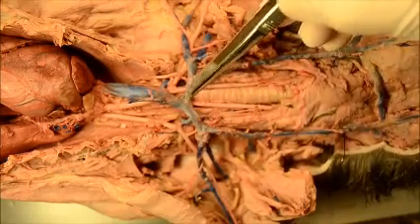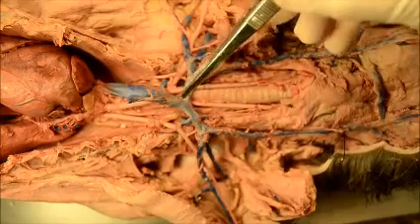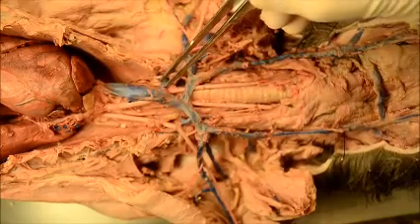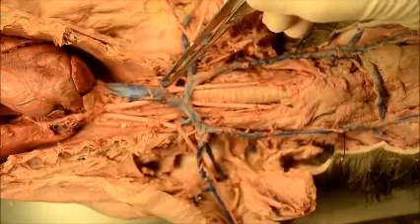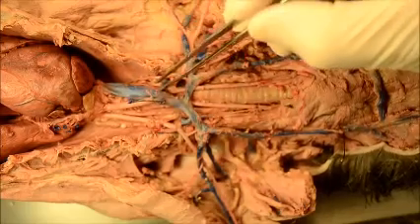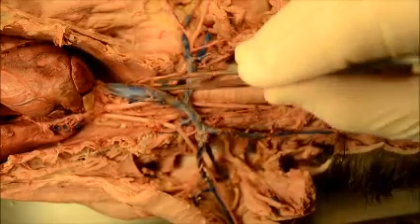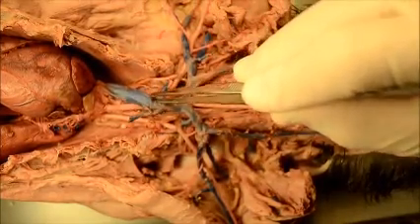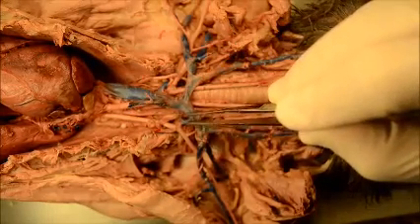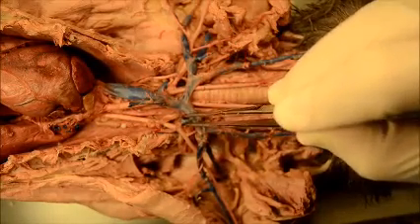This is the brachiocephalic — this is the right, this is the left. Over here is the right vertebral, over here is the left vertebral. Notice that one comes off the superior vena cava and one comes off the brachiocephalic.